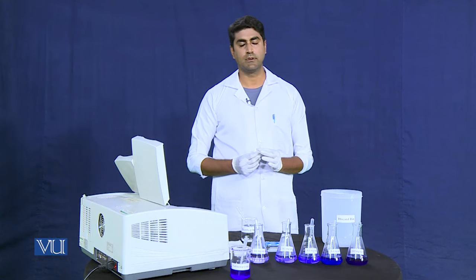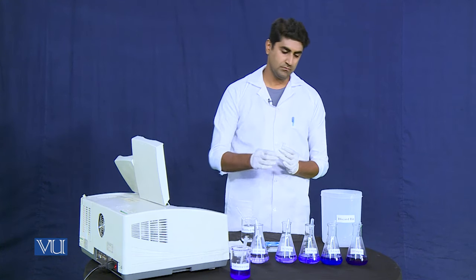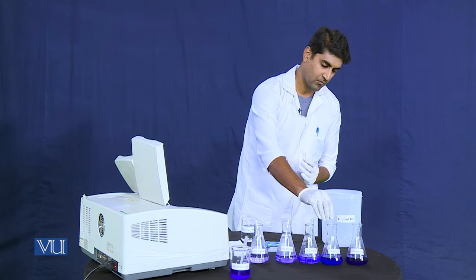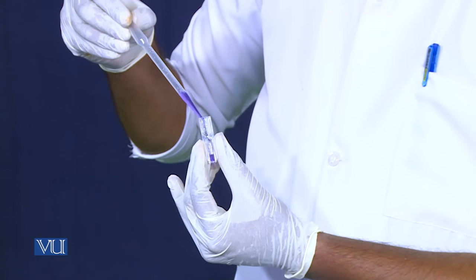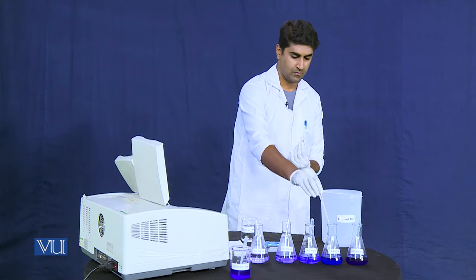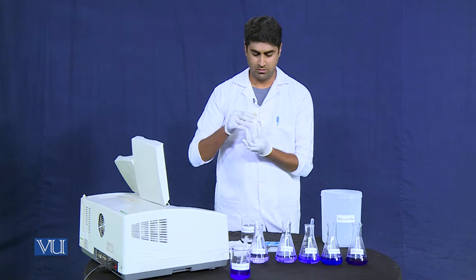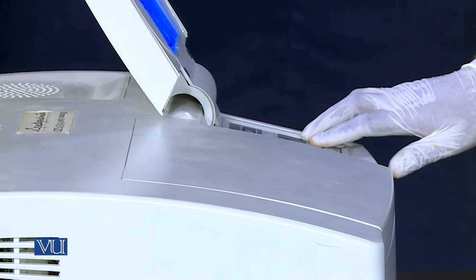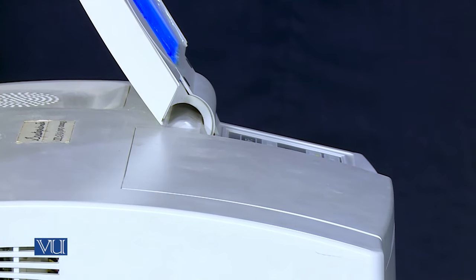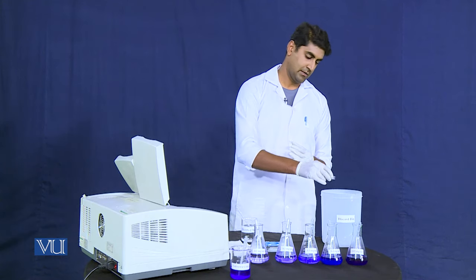Now we will take the absorbance of the fourth standard solution of potassium permanganate, which is 0.4 mg/mL. We clean the transparent side of the glass cuvette before placing it into the cell holder. We close the lid and press the start button to take the absorbance. Then we take out the glass cuvette and discard the sample.